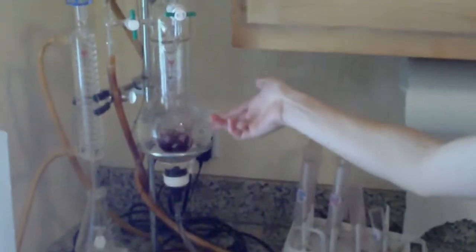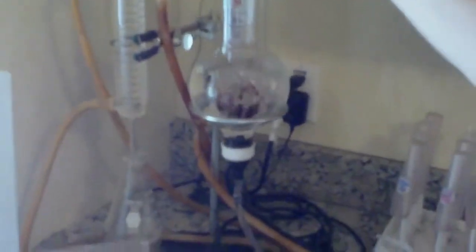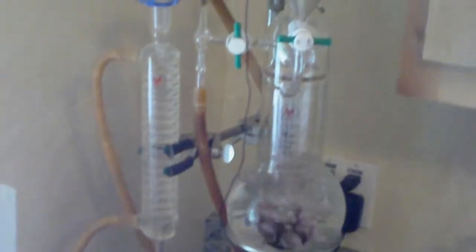I'm going to set this. Because this is boiling, and we're going to have the distillate evaporate, and then recondense back down here, and it's coming out into this glass.